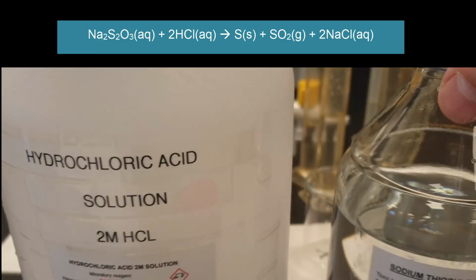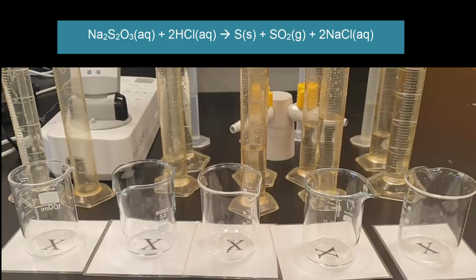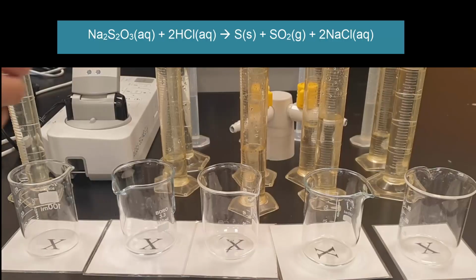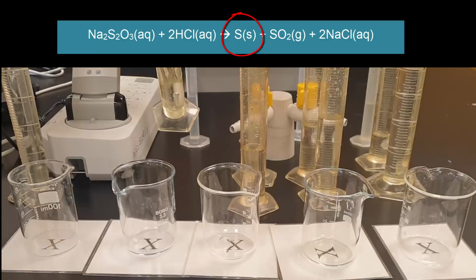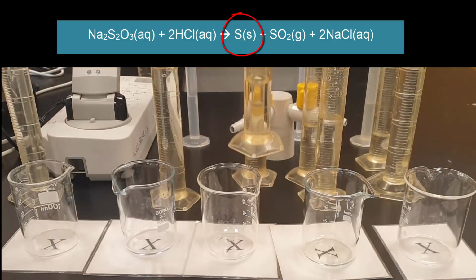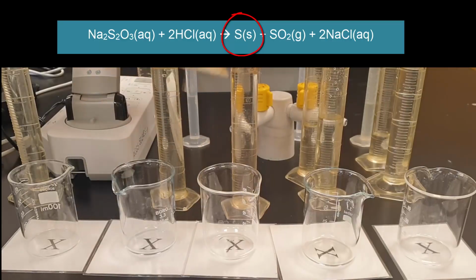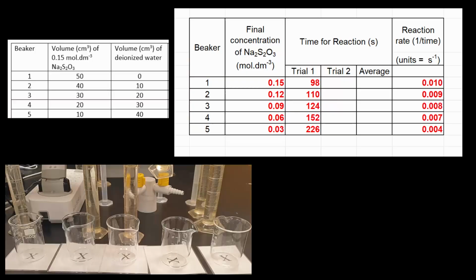This is the classic clock reaction, and we're going to grab sodium thiosulfate and hydrochloric acid, and we're going to use different concentrations. It's going to create sulfur, which is a precipitate, and the sulfur dioxide will come off and be smelly. Sodium chloride you won't see, and the solution will get cloudier and cloudier, so you can't see the X's anymore. So the first thing we do is we're doing 5 concentrations.